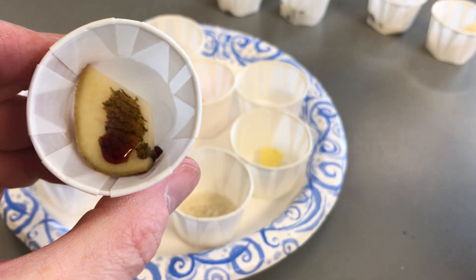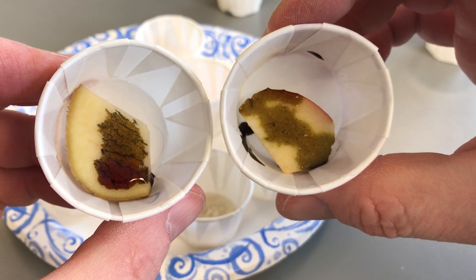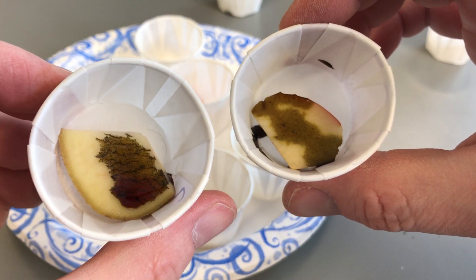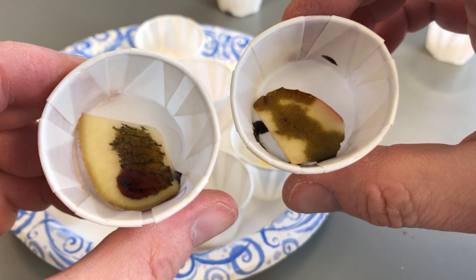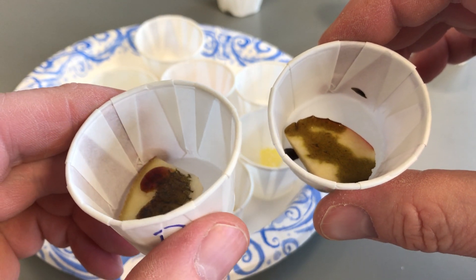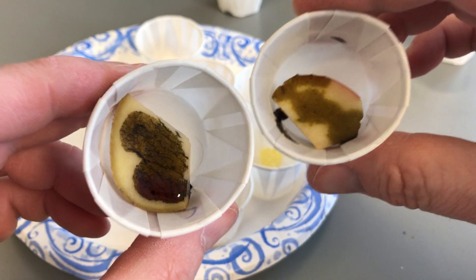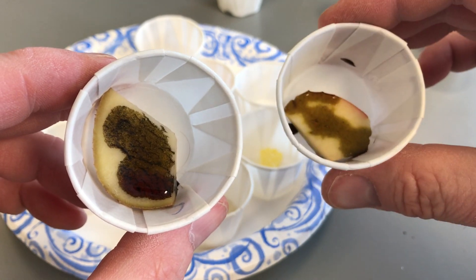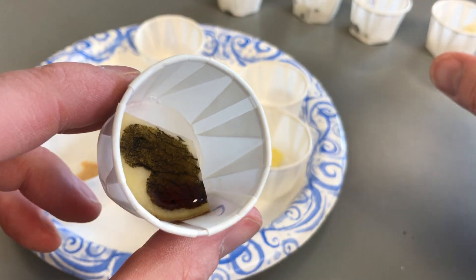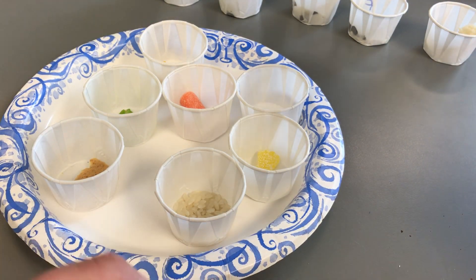The potato is a lot darker — it changed right away. You still see a little hint of amber on the outside where the iodine hasn't soaked in yet, but the center went dark immediately. Comparing the potato to the apple: the apple has gotten darker over time, but the potato is really dark showing a lot of starch present. The potato is a clear positive.